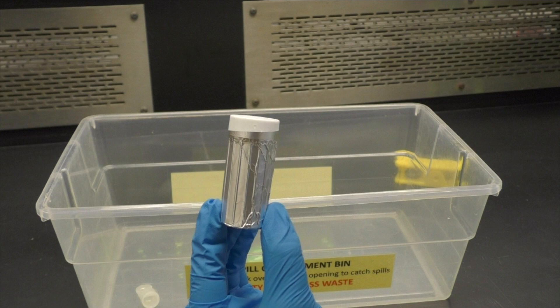The glow stick solution is sensitive to air and light, so while you are waiting, the vial should be capped and covered in aluminum foil.